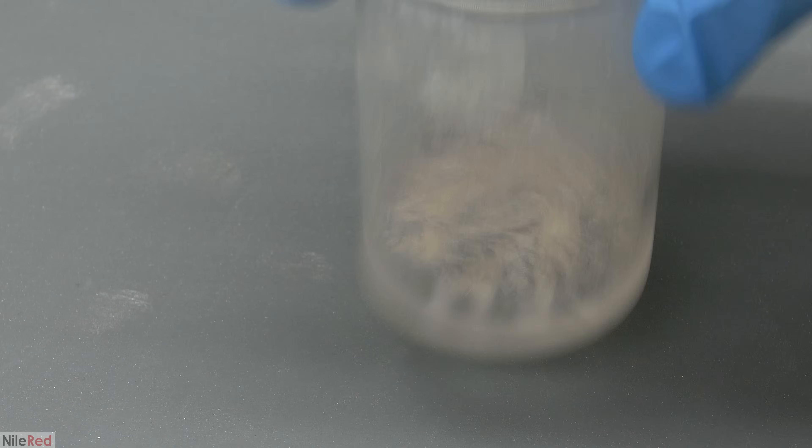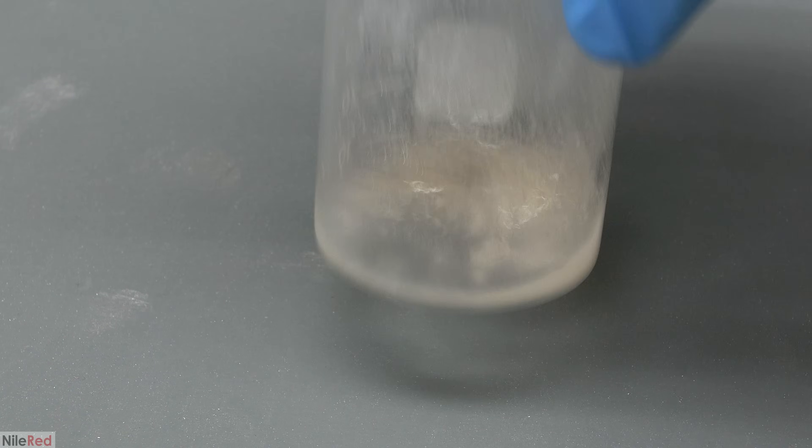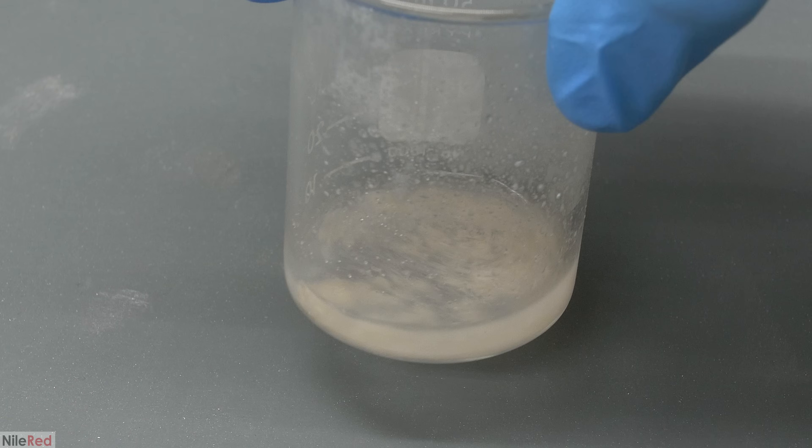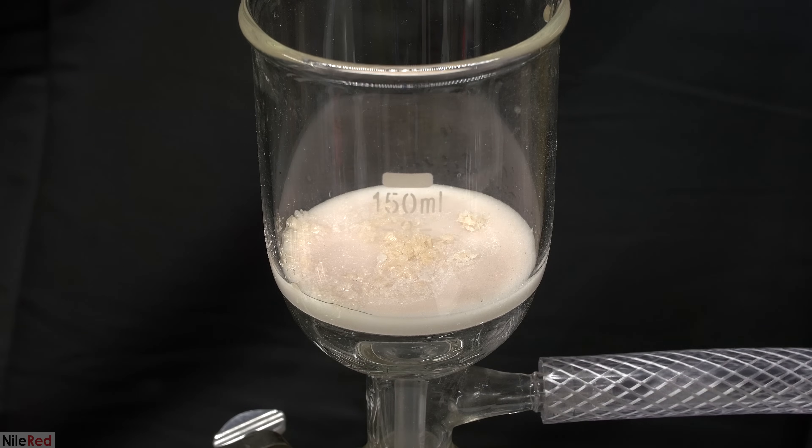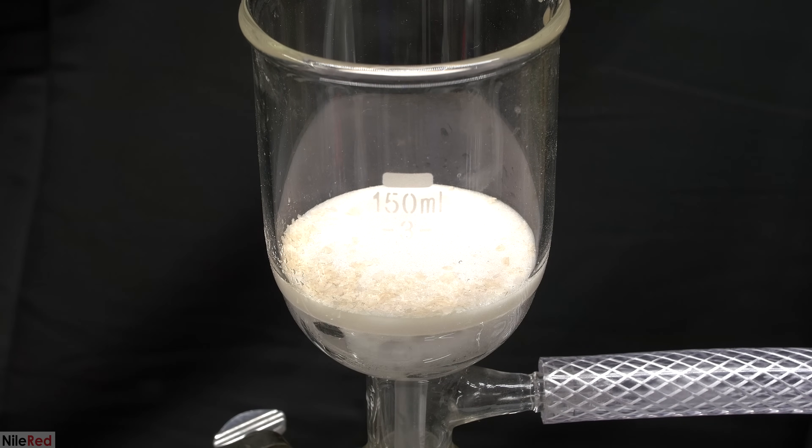After about an hour in the fridge, I think I precipitated as much of the paracetamol as possible. The crystals were then isolated by vacuum filtration, and I washed them a few times with ice cold water.